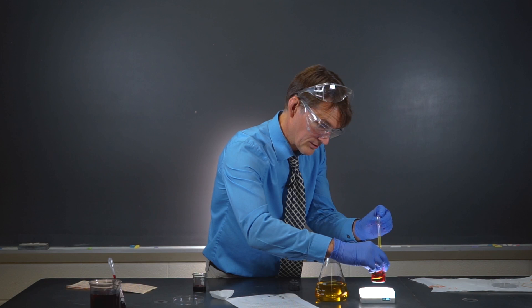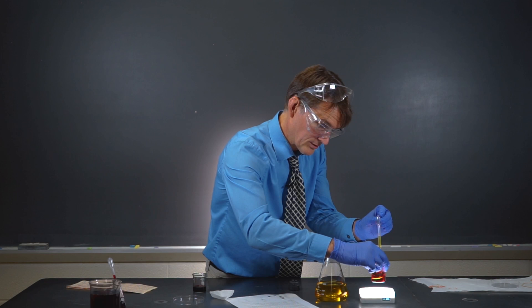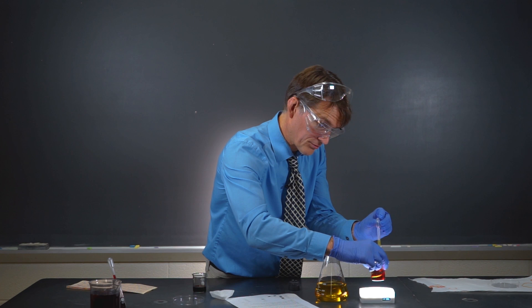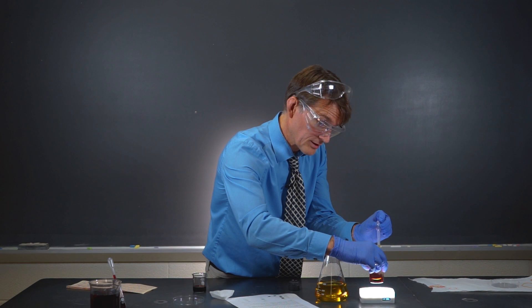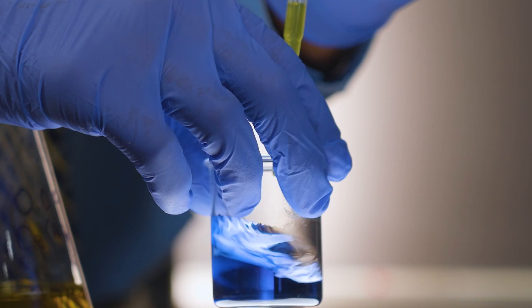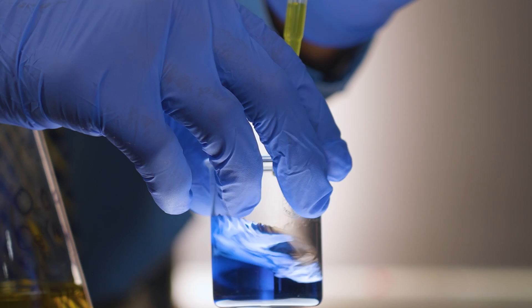That's a nice red. Let's see if we get a nice blue here. So that cerium 4, when it reacts with the iron 2, it makes iron 3, which is going to be blue in the presence of the indicator. But the cerium goes colorless. And that's why we get the color change to blue. There it is. There we go.